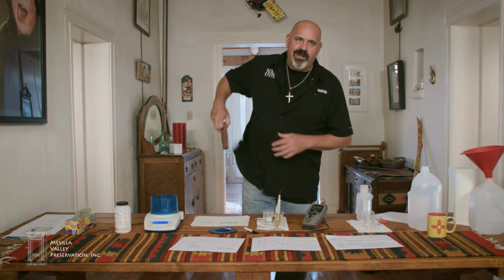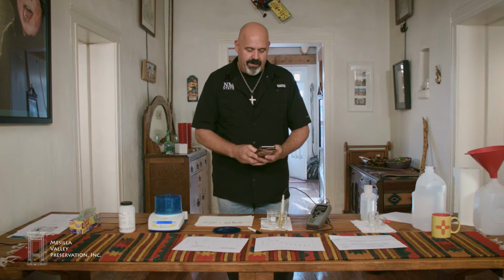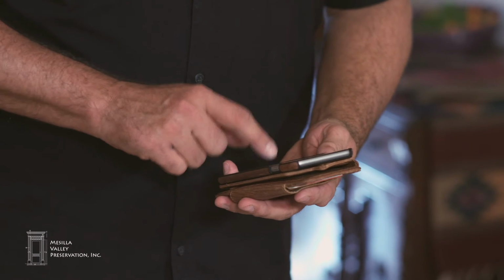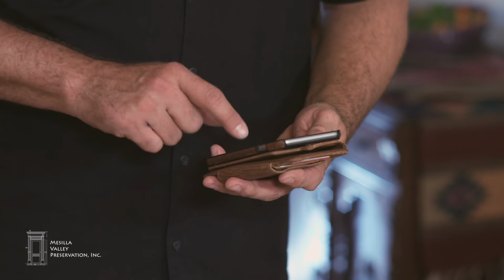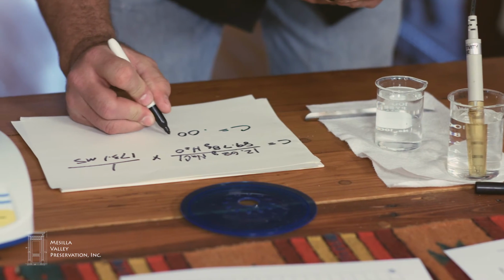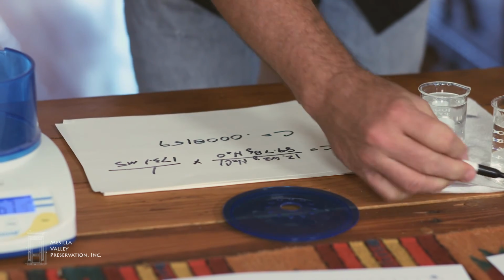So if I get a calculator out, that was 12.68 grams of sodium chloride divided by 89.78 grams of water divided by 173.1 millisiemens means that my calibration constant is 0.0008159.